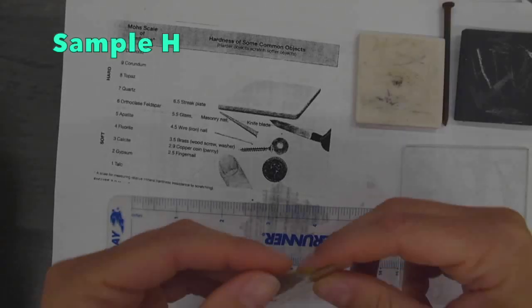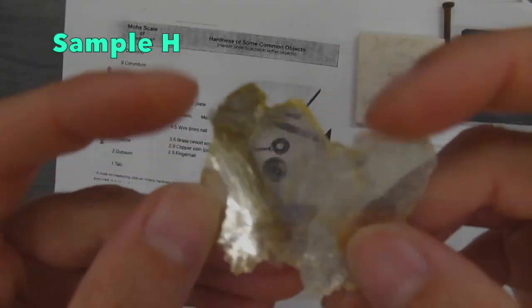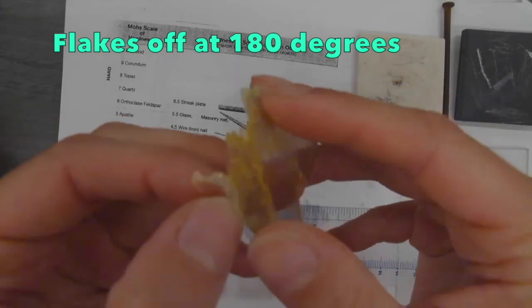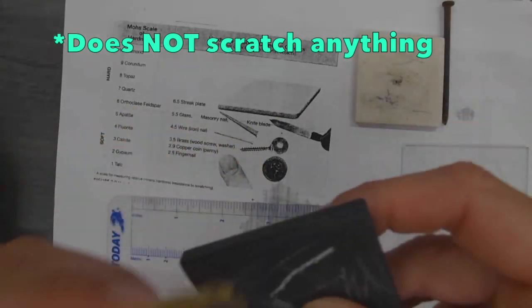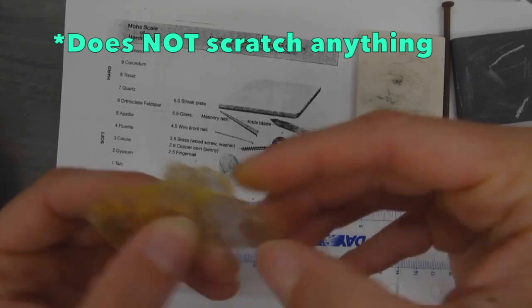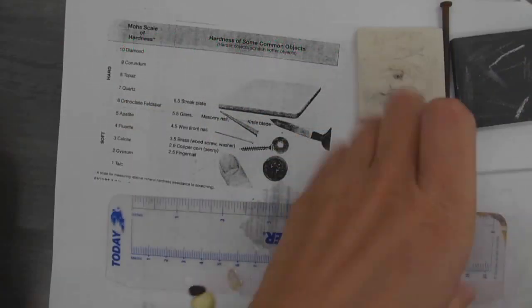Now on to sample H. Okay, this guy's kind of sparkly, one of my favorites because it's kind of fun, honestly. It's going to flake off right there into thin little sheets, and it's not going to scratch anything, not even that streak plate. Not the glass, yeah.